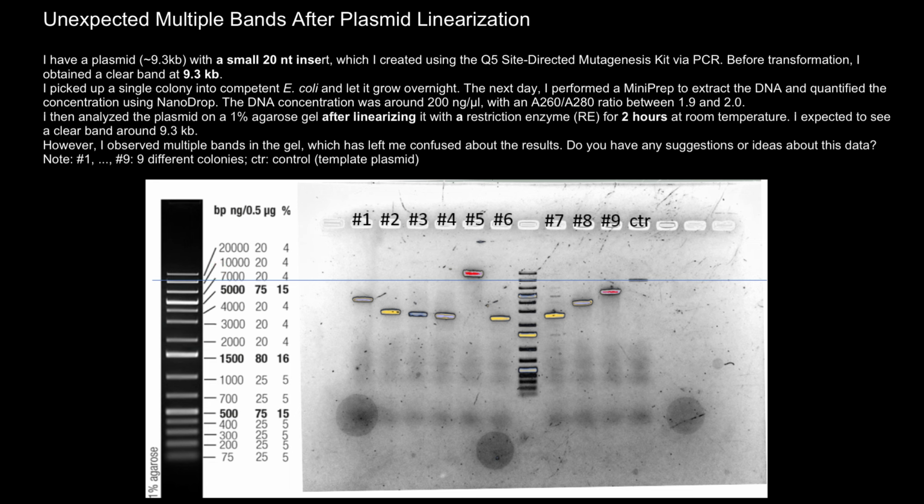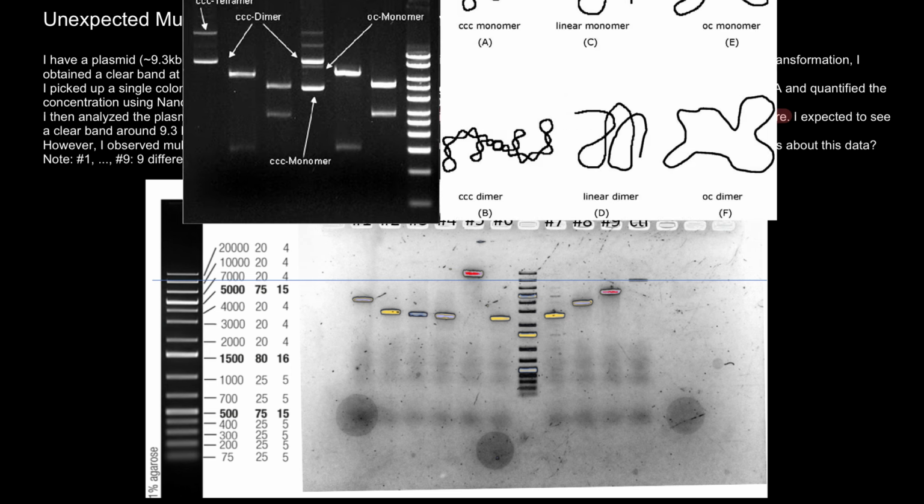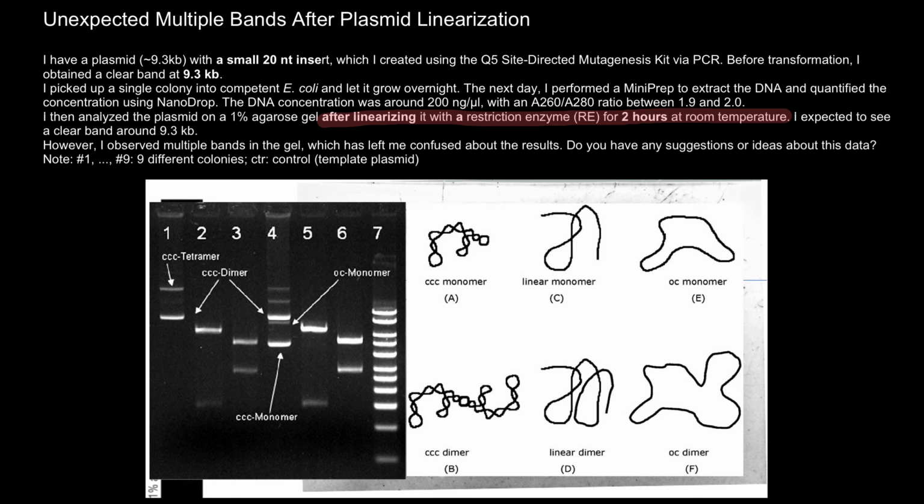So why did this happen? My first question to this researcher would be, why do you digest at room temperature when most restriction enzymes cut optimally at about 37 degrees Celsius or higher? Now, please take a look at this picture. And here you can see different forms of the plasmid that it can take, especially when it's not completely digested.